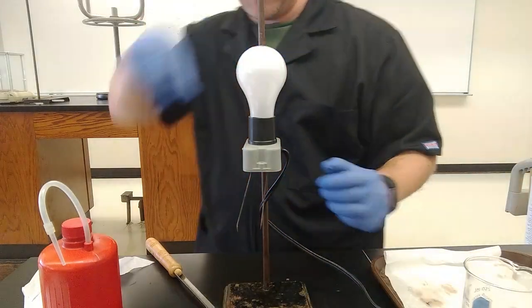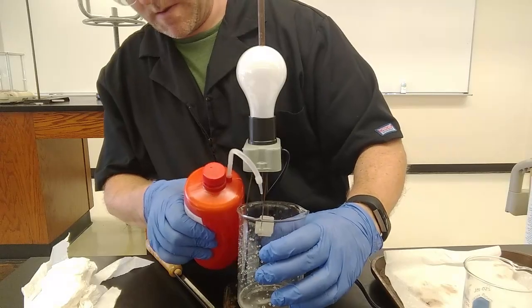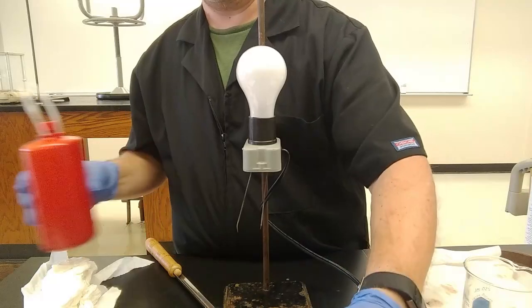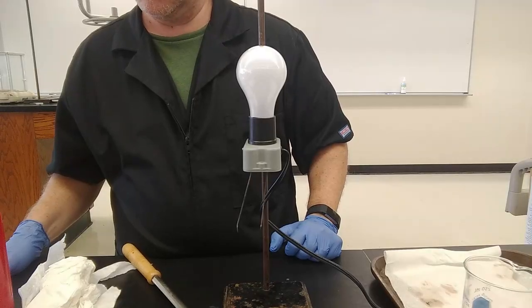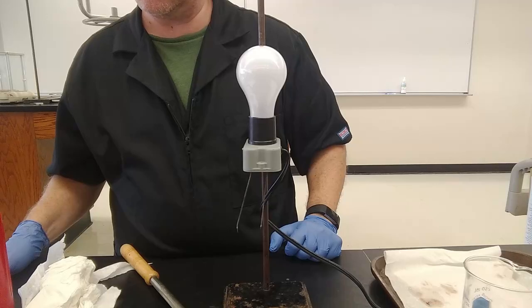Next up, rinse off our electrodes. Hydrochloric acid. So we kind of had ammonia on there twice. Had glacial acetic acid and then acetic acid. Ammonia is only on the data sheet once, but we really had it aqueous and then we added more water to see what would happen.